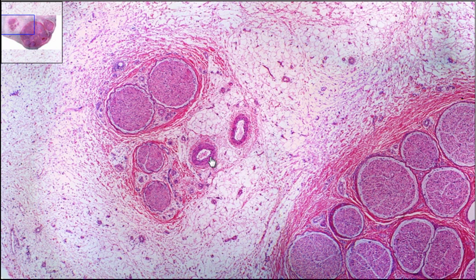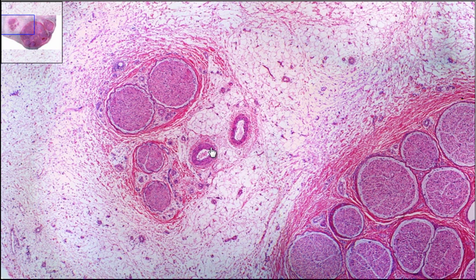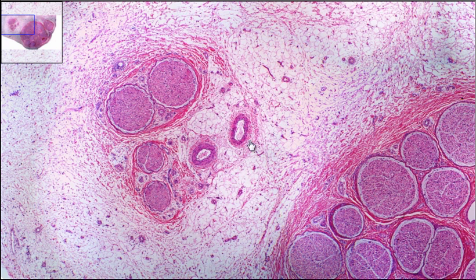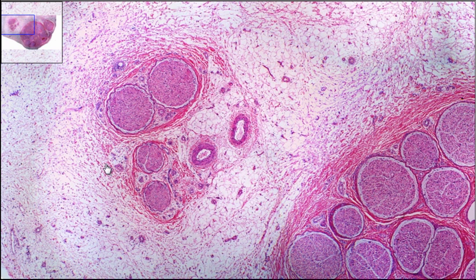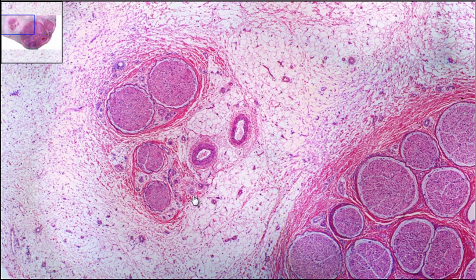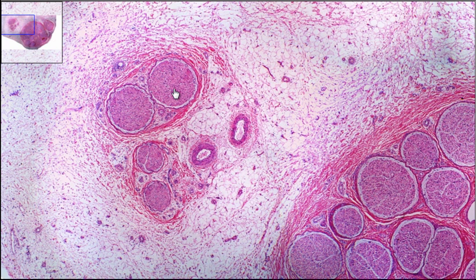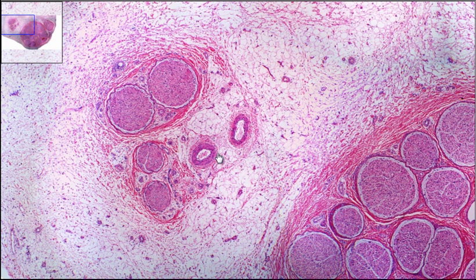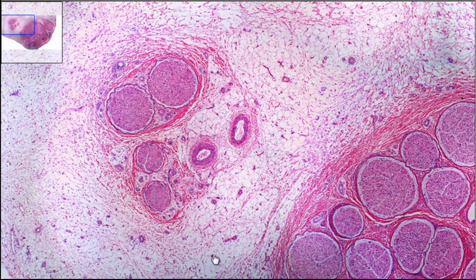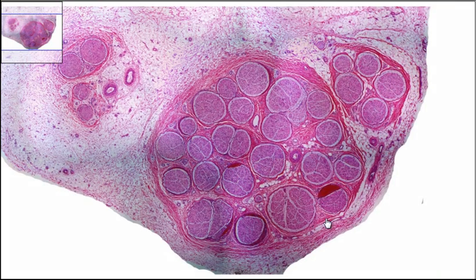Some nerves will have the fascicles bundled with blood vessels. In this particular case, the epineurium that goes around the outside is bundling one, two, three, four fascicles that are nice and large, and then two blood vessels. So we have a portion of the cross-section through a nerve where we get the epineurium, the perineurium, and the individual fascicles.